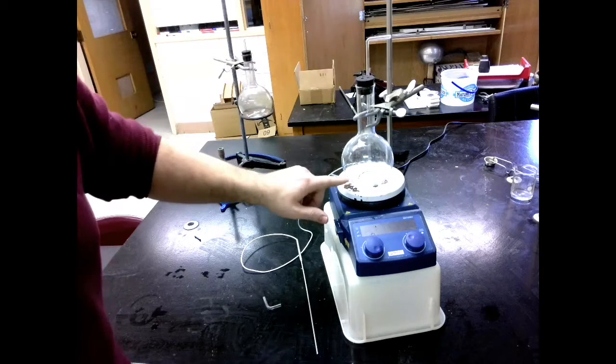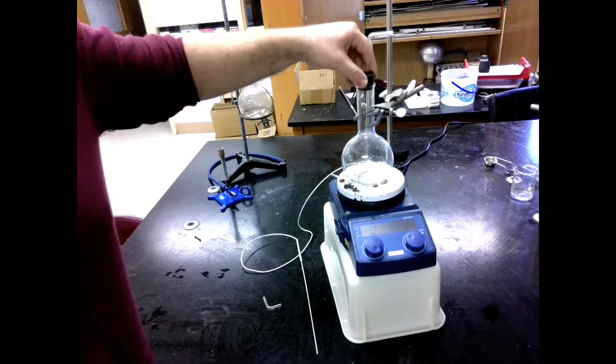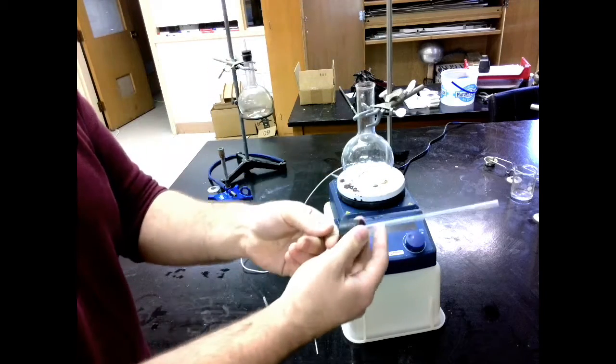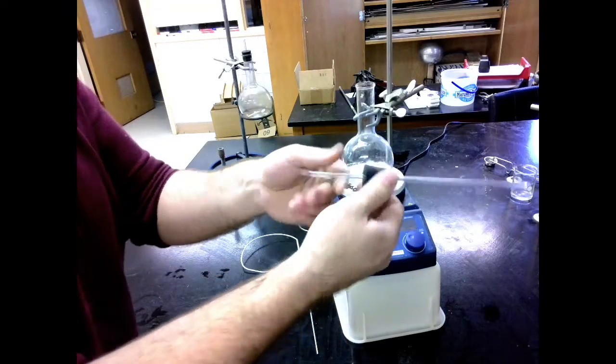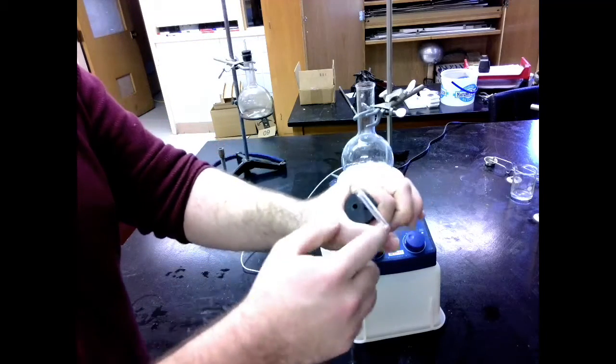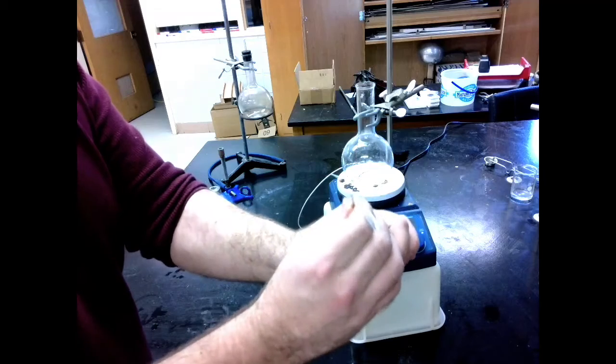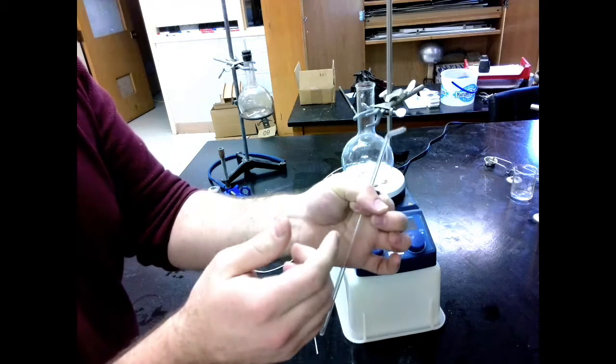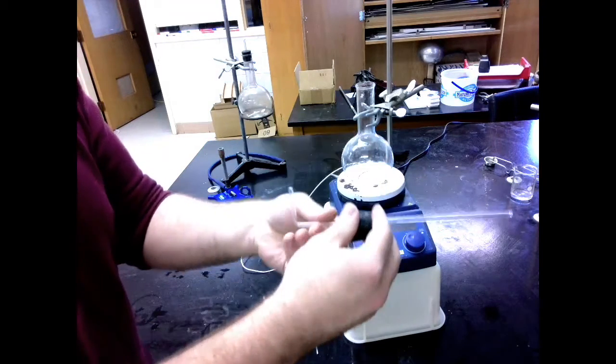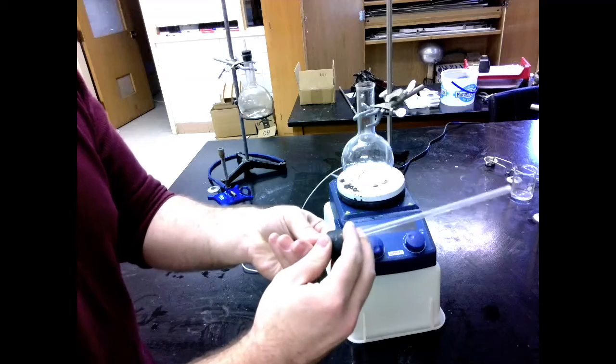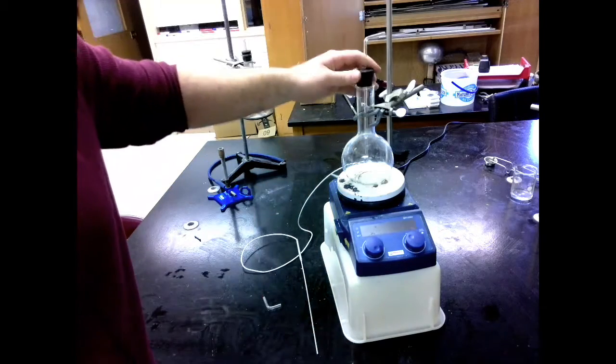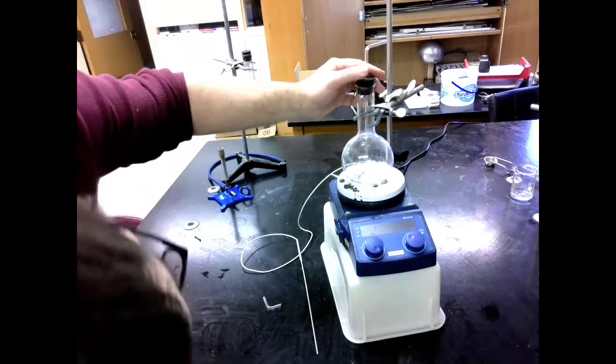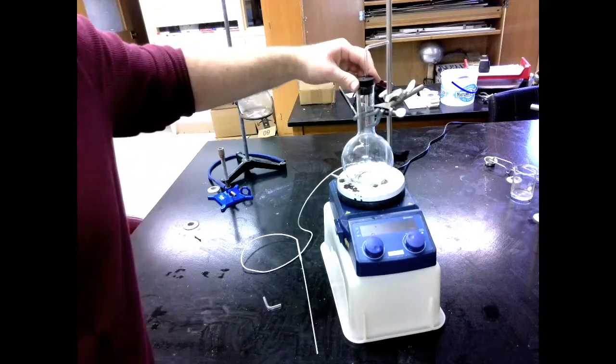I can see that I'm way too high. So I'm going to pull it out to adjust it. Make sure you pull this out to adjust it. Because if you have it in there, the flask will be squeezing the sides of that tube and it won't want to budge. And then it'll be really easy to break. So we pull it out so it's loose. Then we adjust it a little bit. And we're just really guessing and checking here. That looks like a good height.